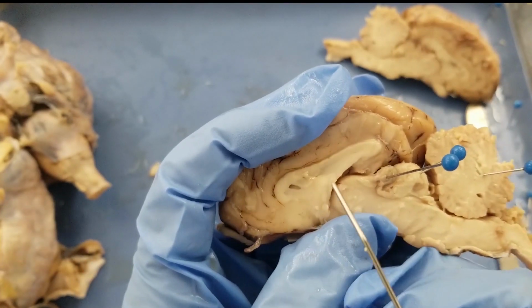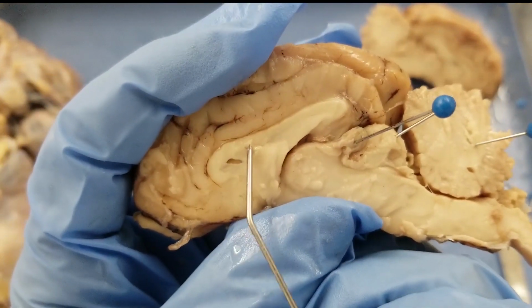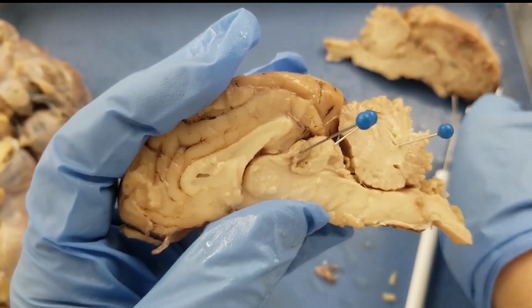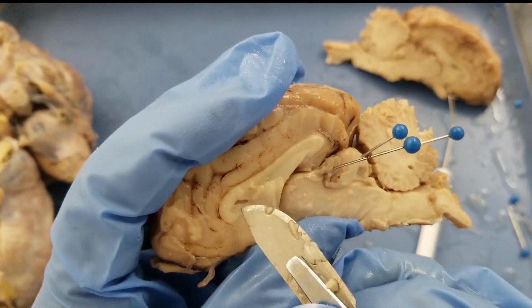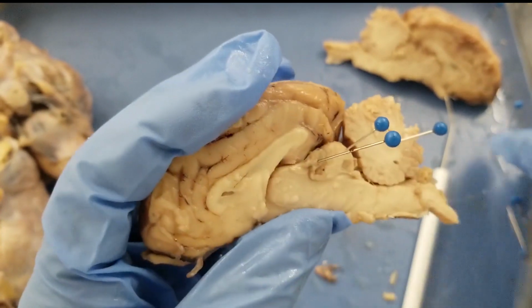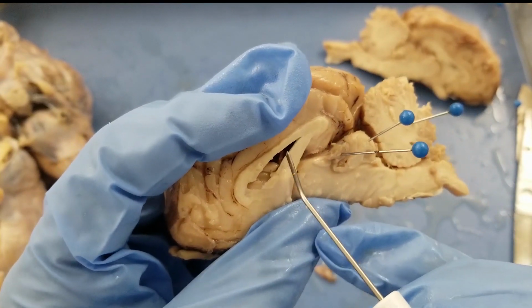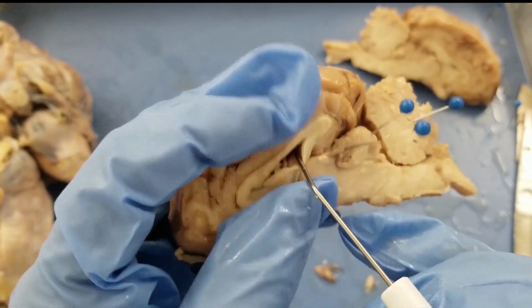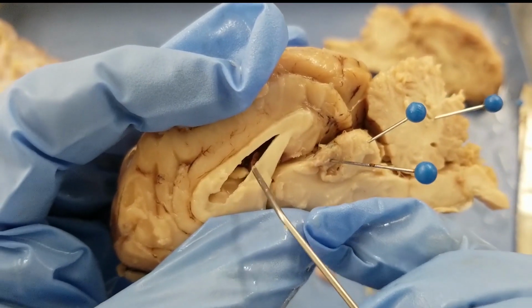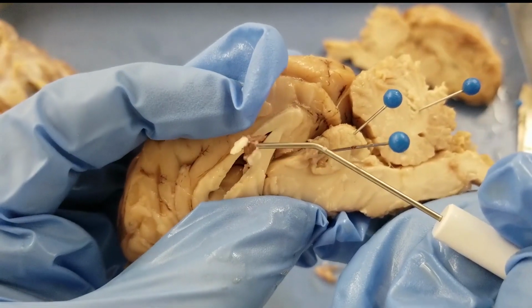And then the next one is the lateral ventricle. Okay, the lateral ventricle is here. And you see there's a membrane covering it. If I cut the membrane, you will see there's a hollow structure underneath. Cut the membrane and keep it separate, and we're going to see a bigger hole here. Whoa, look at that. A whole new world. Okay, so that's the lateral ventricle.